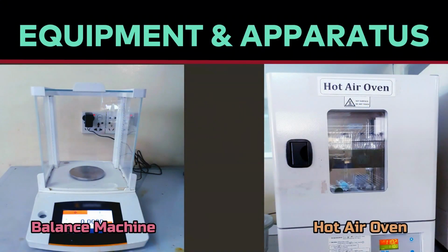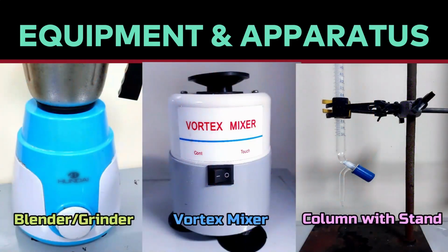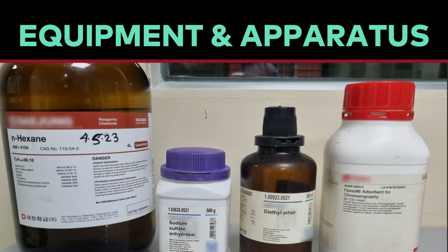For this method of sample preparation, we need a balance machine, hot air oven, rotary evaporator, blender machine, vortex mixer, glass column, glass bowl, syringe with filter, desiccator, chopping board, beaker, conical flask, glass dish, separating funnel, hexane, diethyl ether, sodium sulfate anhydrous, and activated florisil.